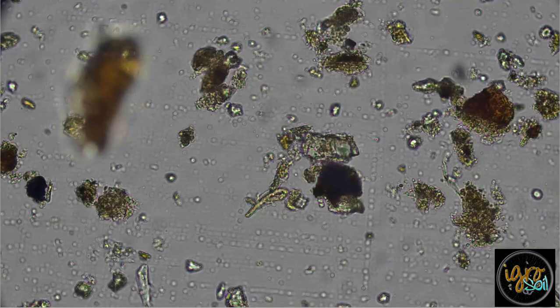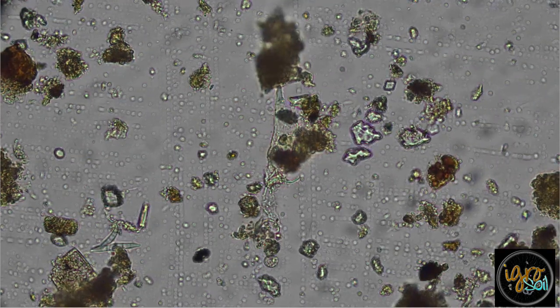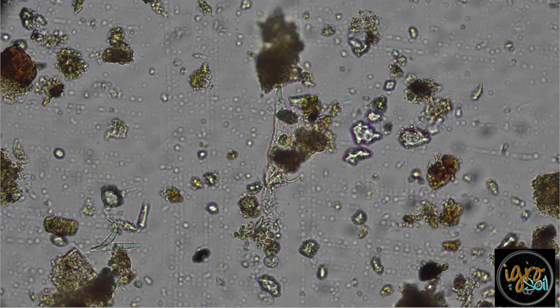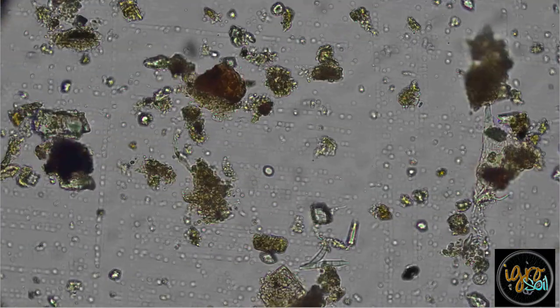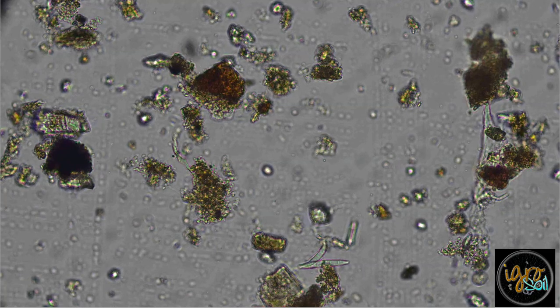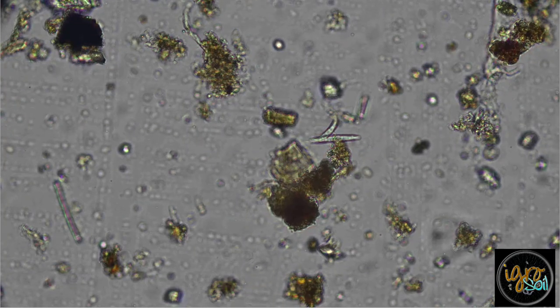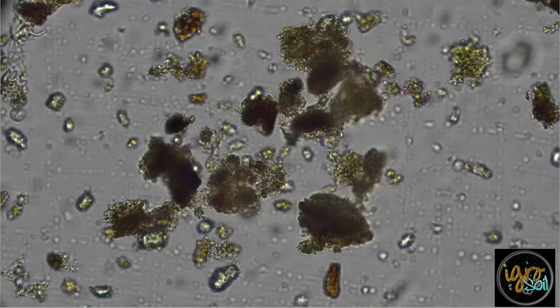Again, I'll type this up for you. I don't know what else may be in here. Look at these guys just hanging out here. You got two of them here, just hanging out, just tearing up your soil, killing your trees.